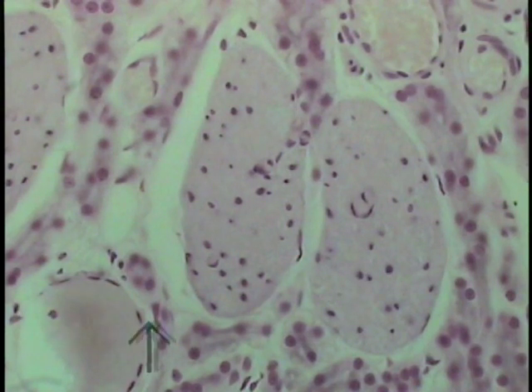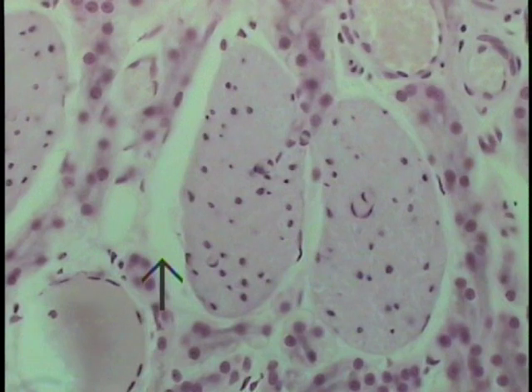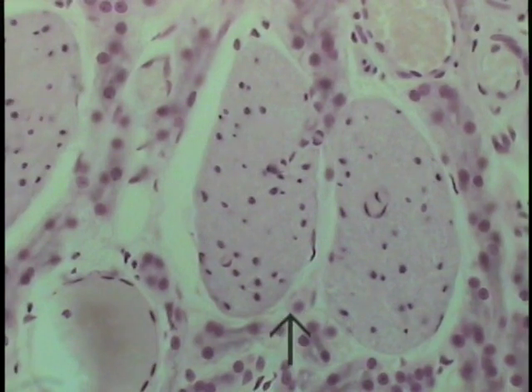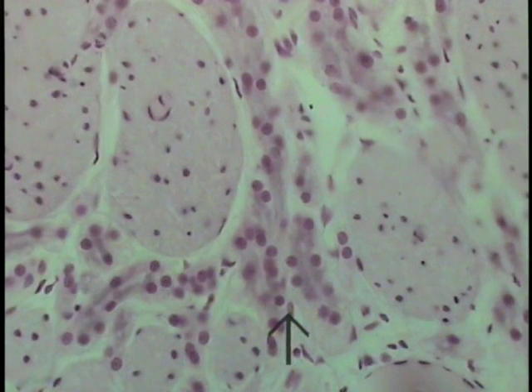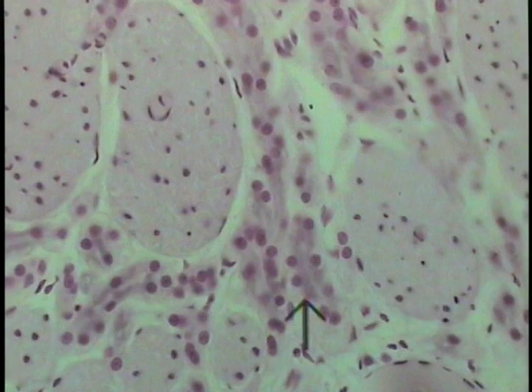Another venous sinus is located in this particular location, and these surrounding elements shown here are branching profiles of the olfactory glands. A very light staining serous appearing gland. The basal cell surface is located about here. You can see they have little apical granules that give this darkness to it.